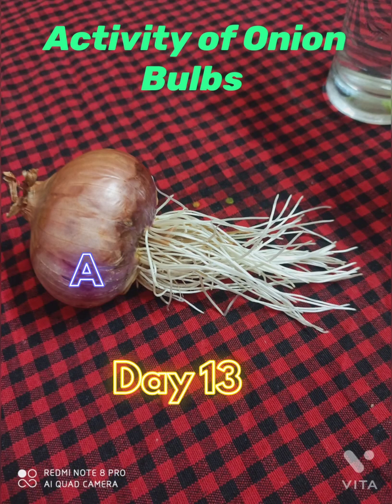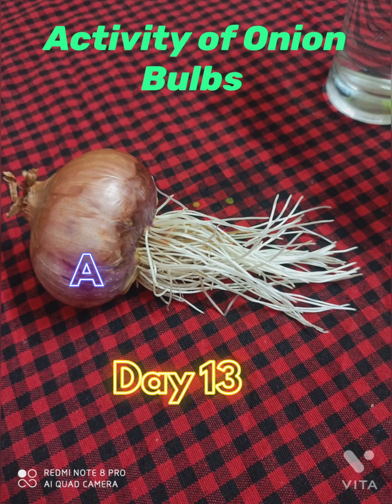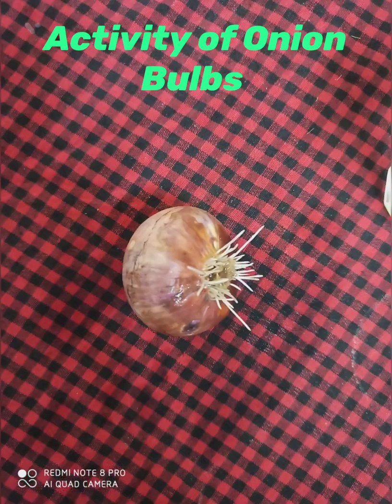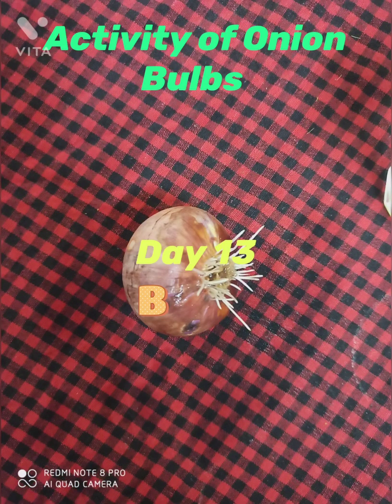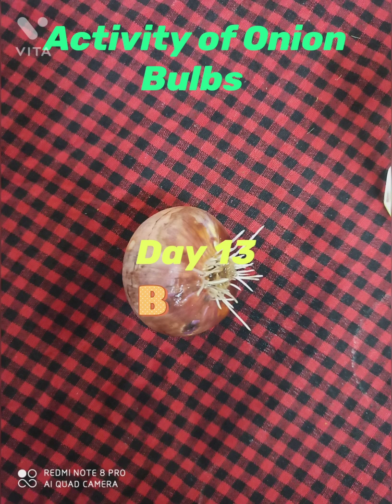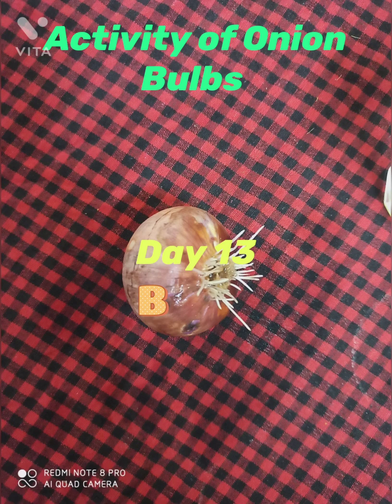On day 13 I have taken out the onion bulbs from both beakers to show you. See how much they have grown in beaker A, whereas in beaker B there is no growth because the root tips were cut.